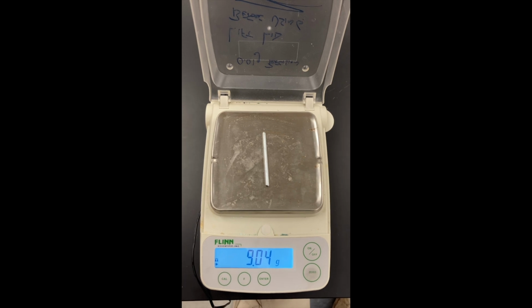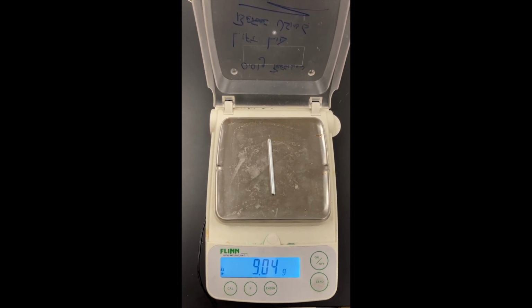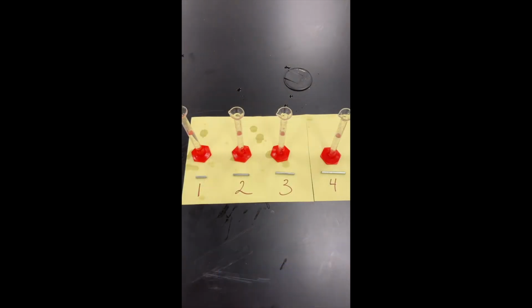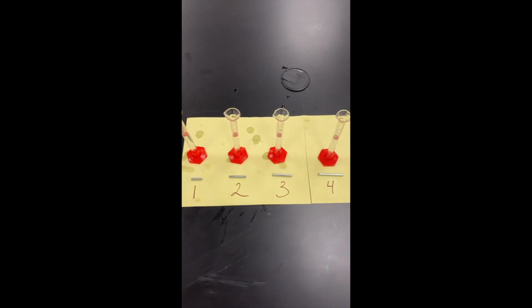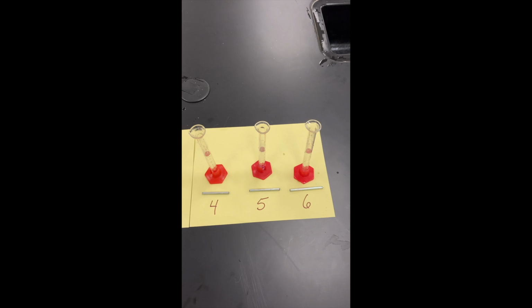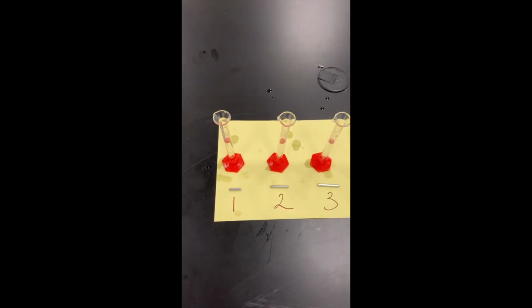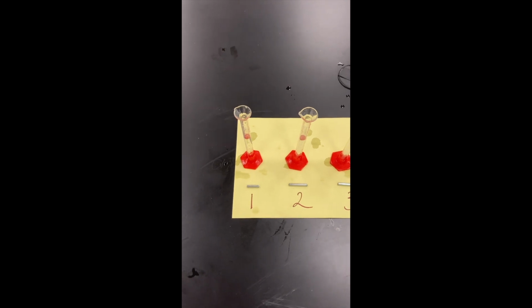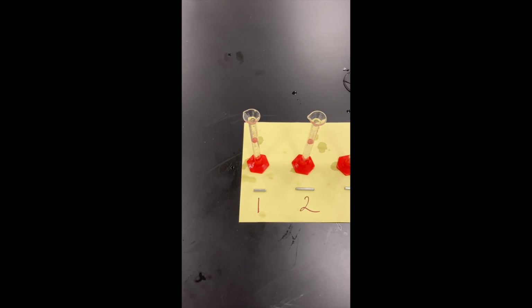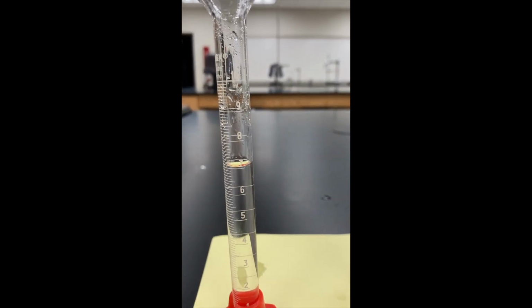And as we expected, the smaller pieces weighed less than the larger pieces. And you should see in your data table that the masses keep getting bigger and bigger. In order to find the density of material, you need to know its mass, which we've already found when we were taking masses on the balance. And now we need to know the volume of the piece. So the pieces are irregularly shaped. They're tough to find a volume by using some math. So instead, we're going to use a lab technique that's called water displacement.